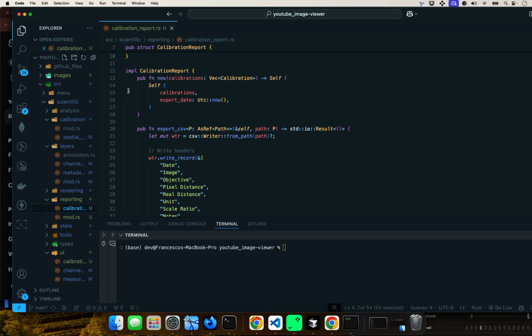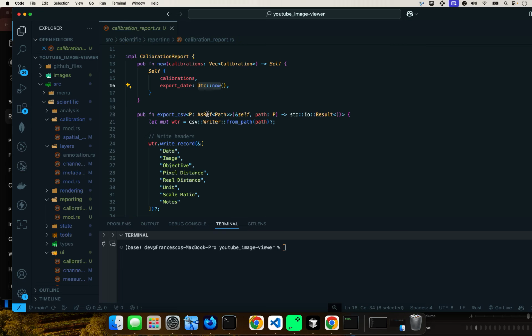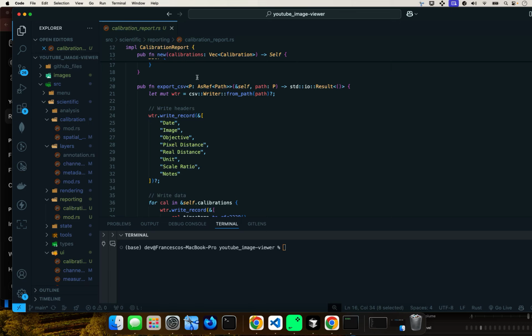Okay, this is the implementation block for the calibration report. The constructor for the calibration report is going to take a vector of the calibration as input, and it's going to set an export date to the current time using UTC now. So it's going to be whatever time is being used. That's what's happening here. So we continue down. This is going to export the calibration report to a CSV file. P is a generic type that must implement AsRef path, and it's going to allow you to change whatever path it is. It's all working with the standard input-output, and it's going to give you the result.